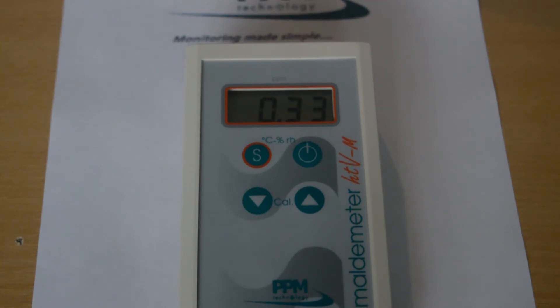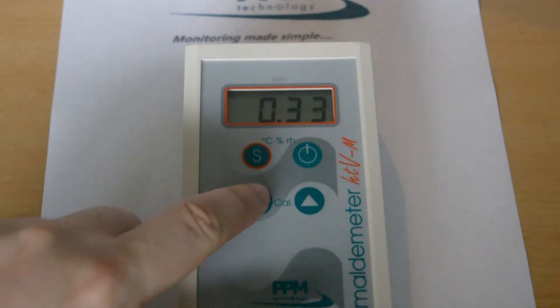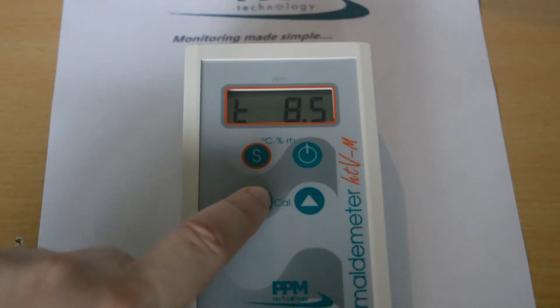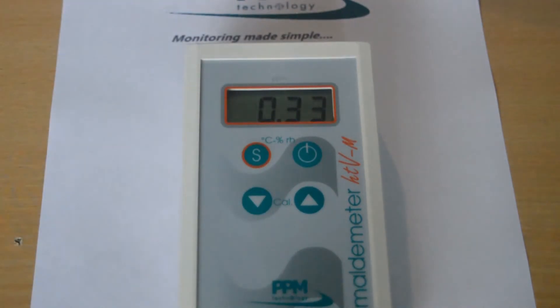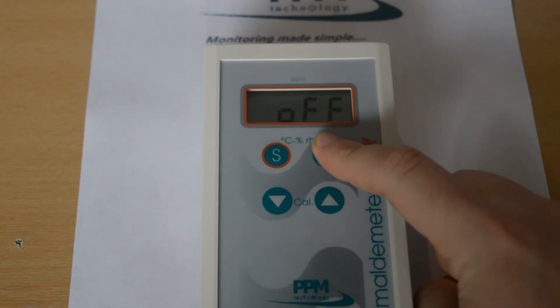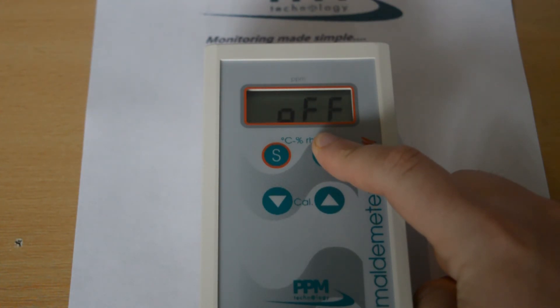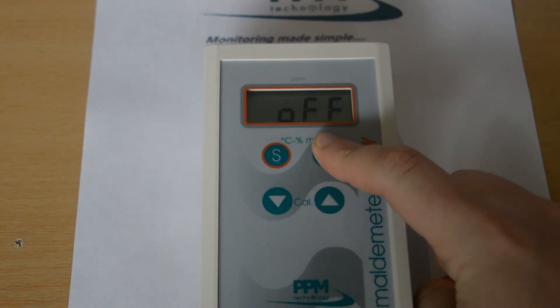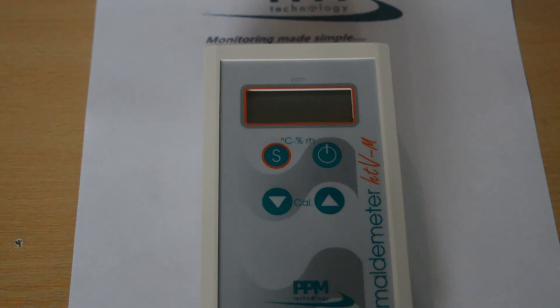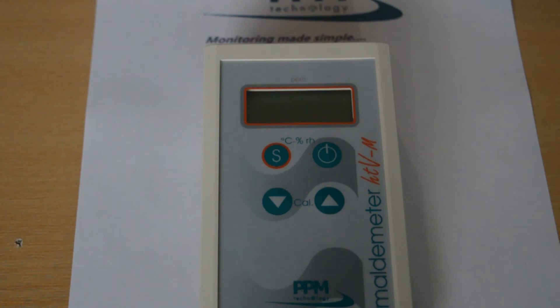It is important to note that the instrument will display the value measured until it is switched off. To turn off, simply hold the power button again until the screen displays 'off', at which point release the button. But just in case you forget to, the instrument will switch itself off after 5 minutes.